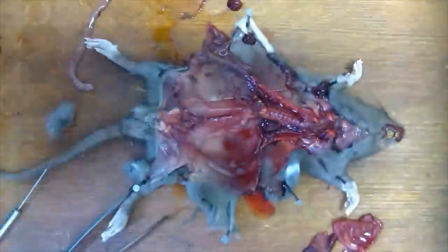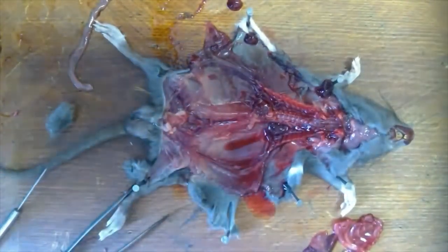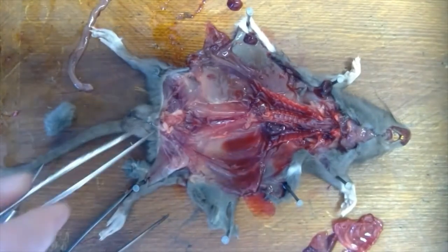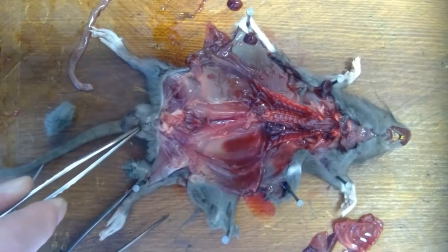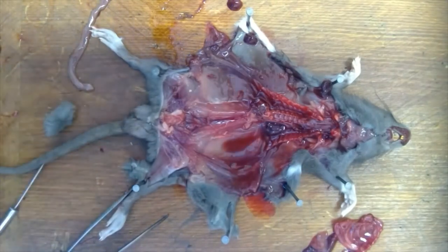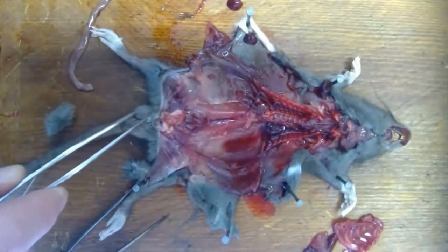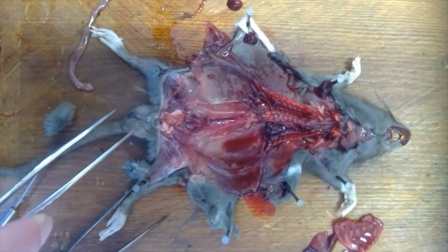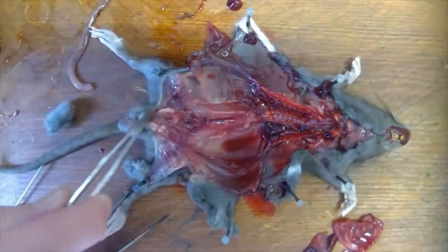We've got ten minutes left — those are the three major systems I wanted to take you through. While we're down at this end, you can also see the reproductive system of the rat: this is a male with two testes here. There's not a lot to see on testes when dissected unless you look under a microscope, where you can see the cells producing sperm, which is quite interesting.